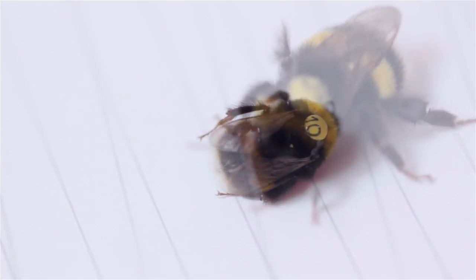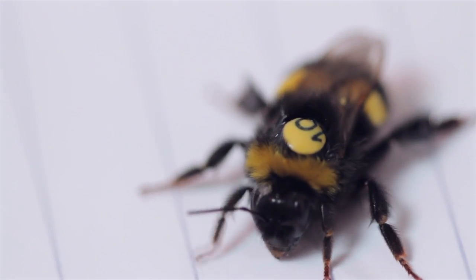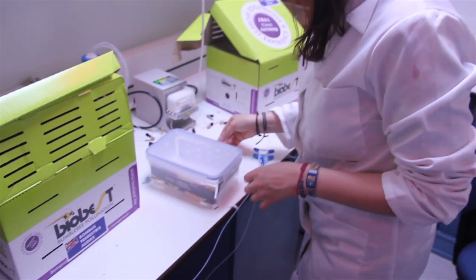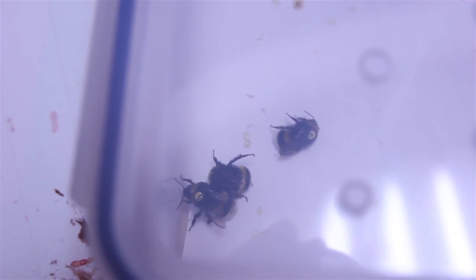Number 10 is starting to wake up. You can see her moving her legs, moving her mandibles, moving her antenna. All that is part of her trying to warm up. Maybe if I introduce her to one of her sisters. What she'll actually do to wake up is flap her wings, because by flapping her wings she'll be increasing the temperature of her body.